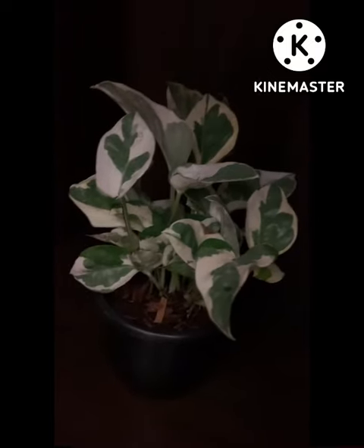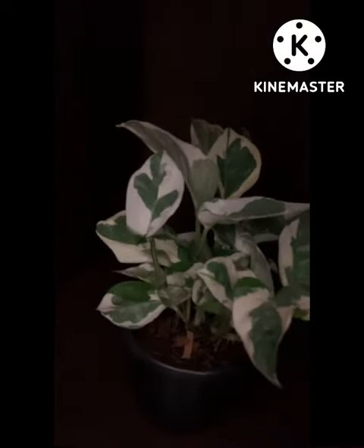I have kept this plant in the dark in a cupboard and I am switching off the light. The plant has been kept in the dark to destarch it. We need to destarch a plant so that all the food that has been prepared by the plant is gone, and then only we can test for the experiments of photosynthesis.